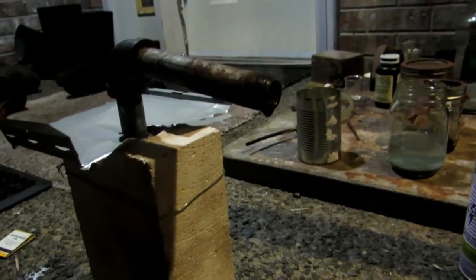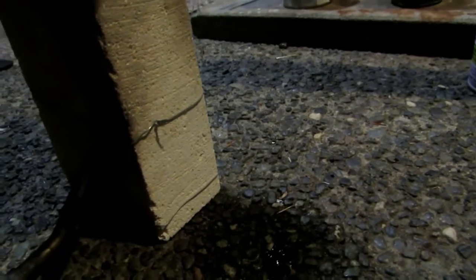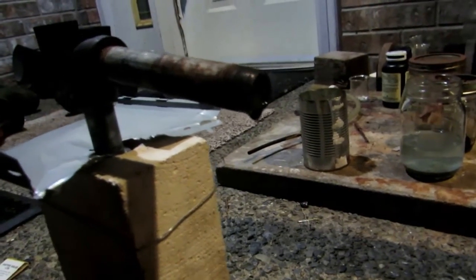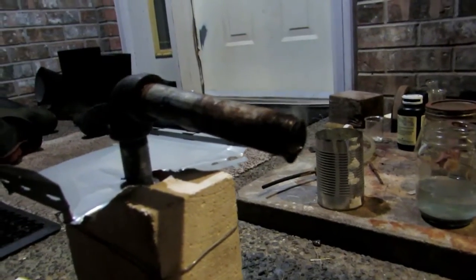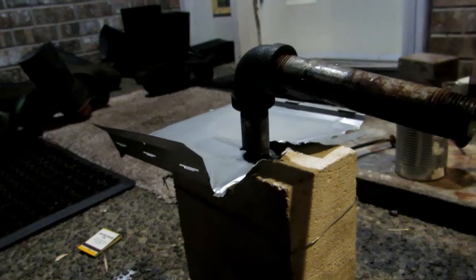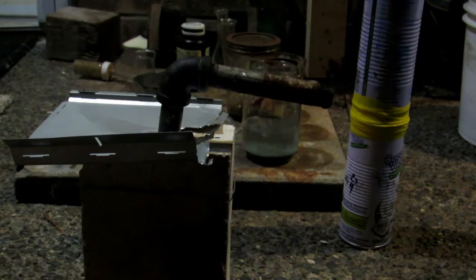This is actually rather interesting — the smoke stopped then started up again. We can see a drip on the end and we've been dripping down at the bottom, actually distilling some sort of compound. I have no clue what the compound is and I'm not going to save it because it's extremely impure and very black. I've also covered it with a piece of metal to help warm things up and trap some heat.